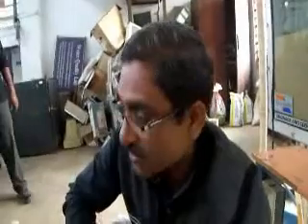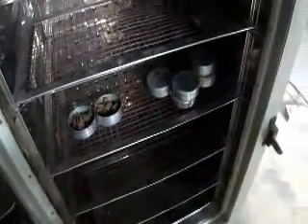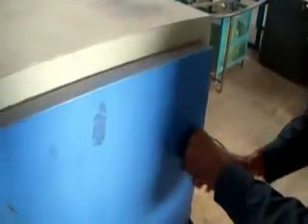Now let us put these samples in the oven for 24 hours, working at 105 degrees Celsius, and then we will measure again the weight of these samples. Okay, so now we need to put these samples in this oven. We are putting these samples, we need to open them, put them here, open so that all moisture is removed. Here, close this. These samples should be dried for 24 hours.